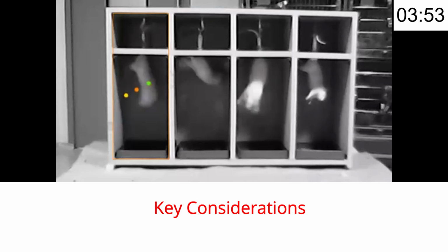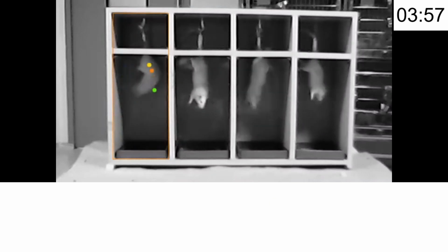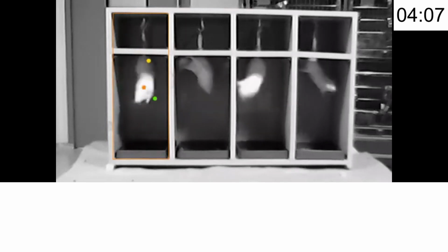Now we will see the key consideration points. Use a suitable background for clear visibility. For example, a dark background for albino animals. If you are using C57 mice, you need a white background. And for a white rat, you need a black background. So likewise you have to manage.